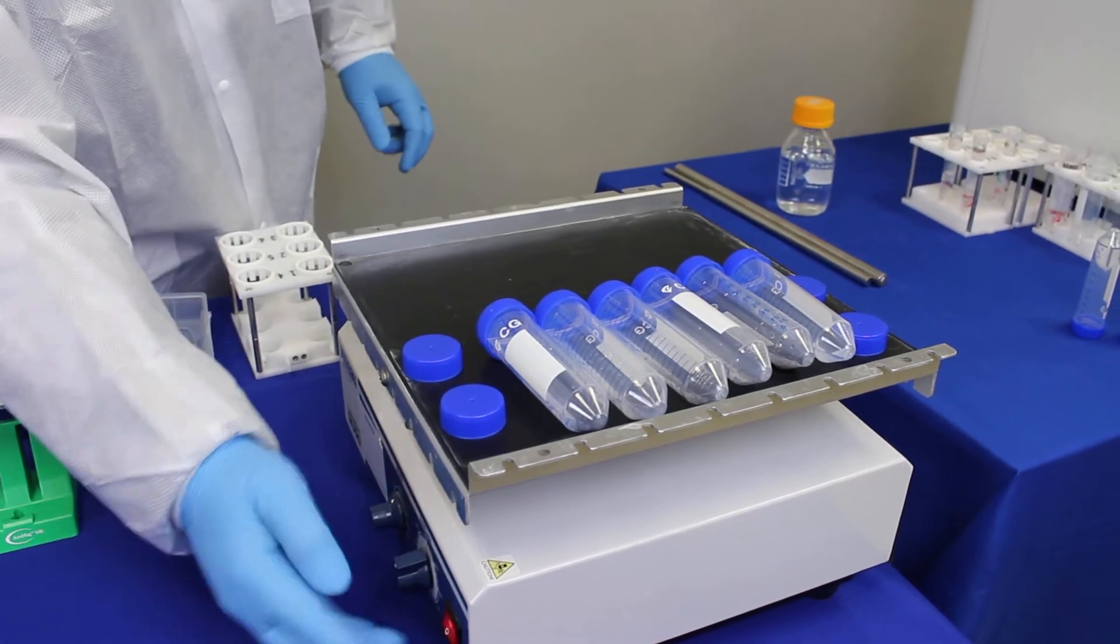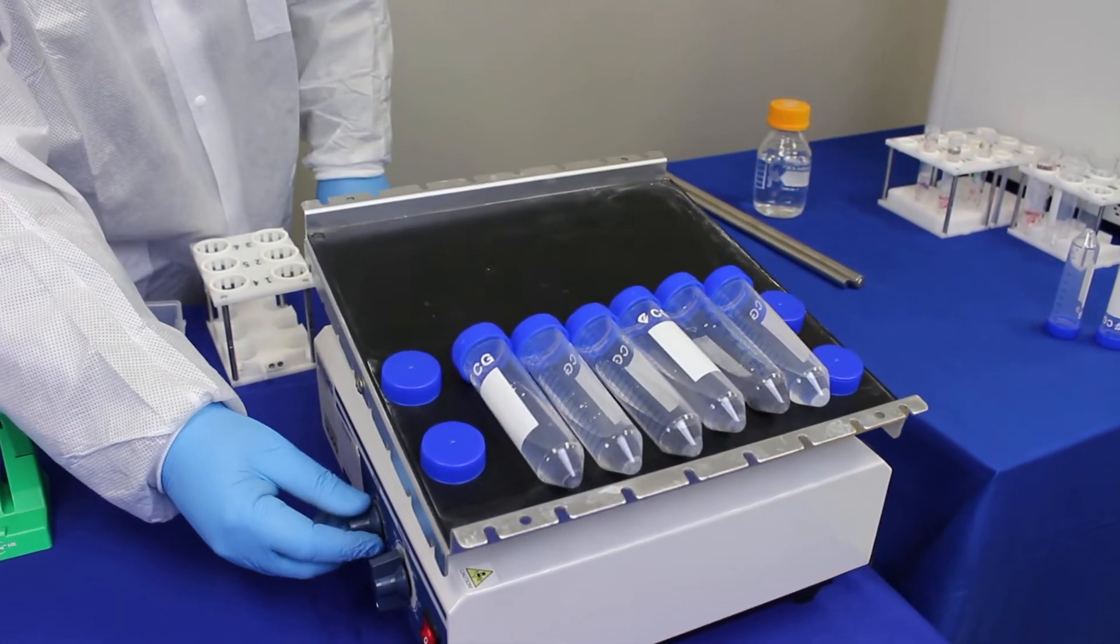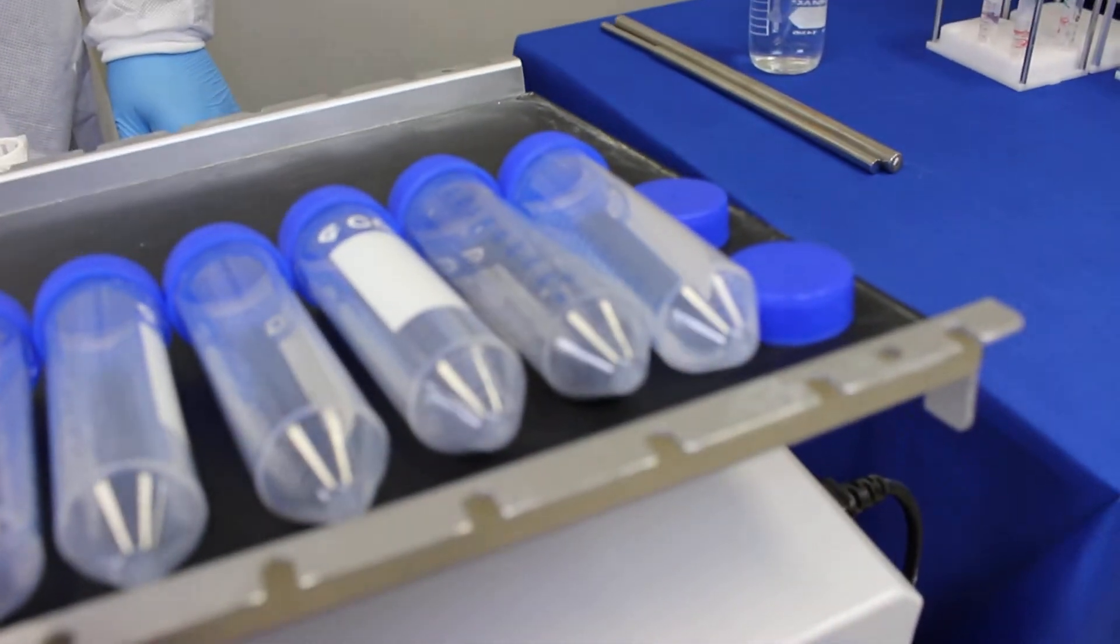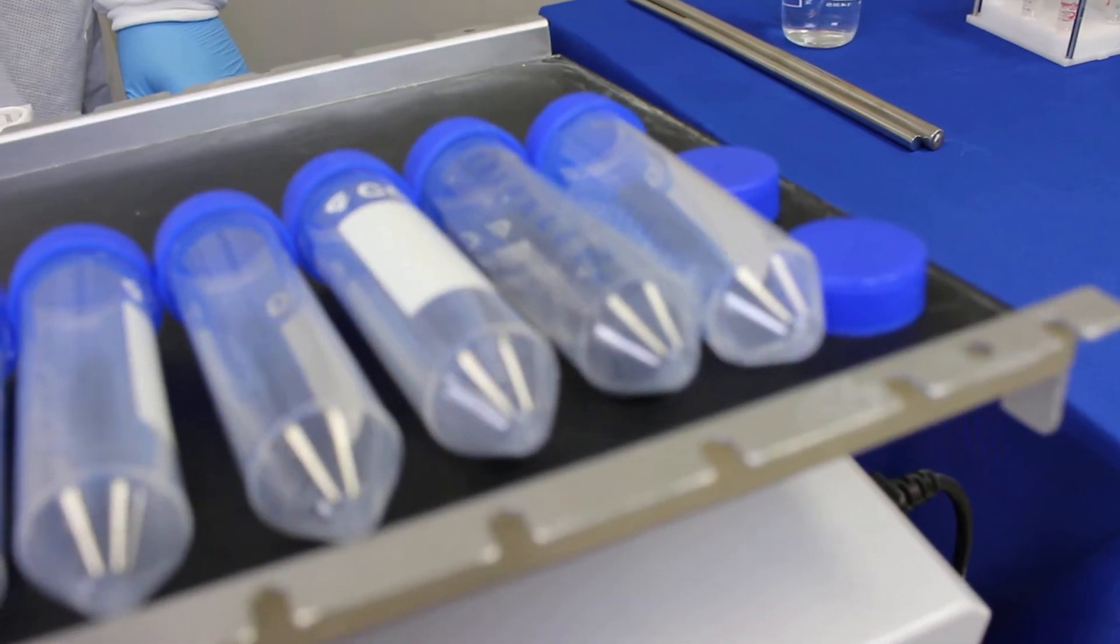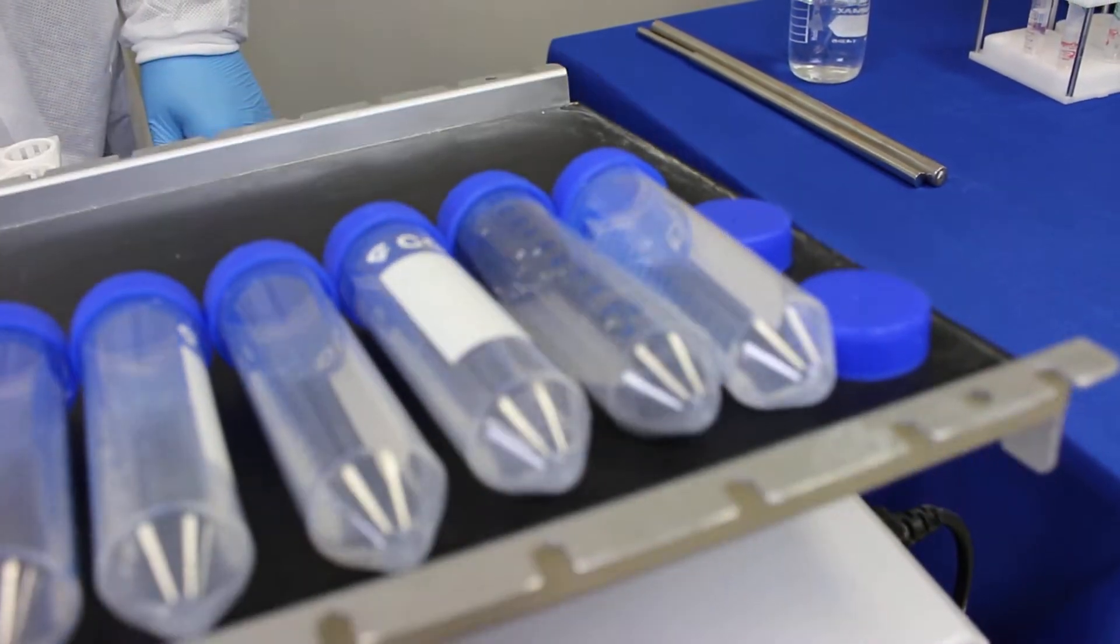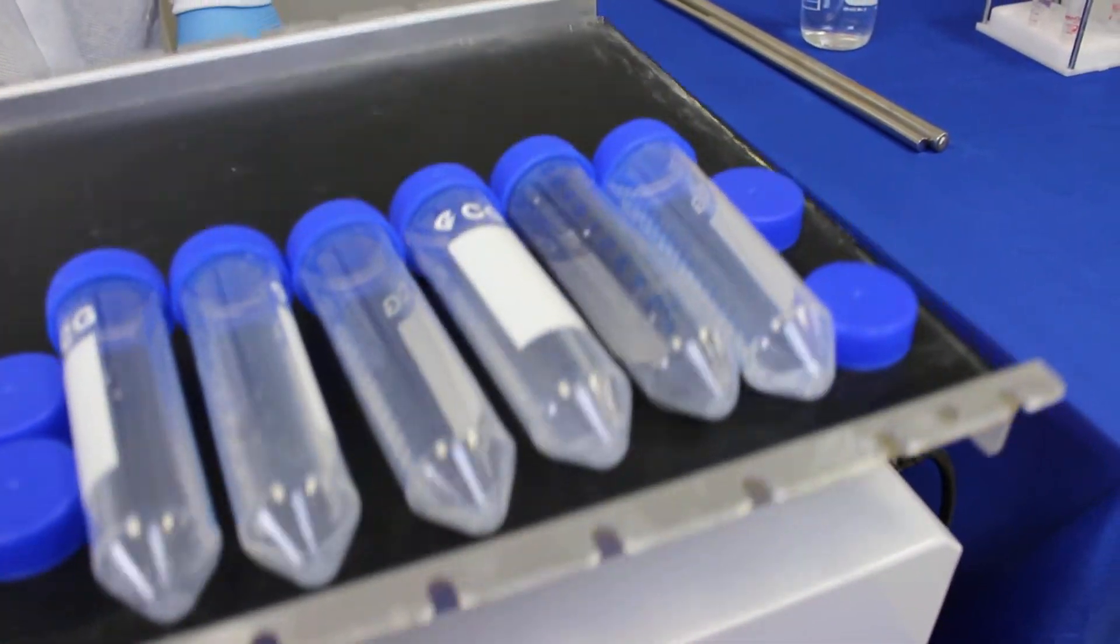Then you switch on the shaker and make sure to adjust the speed so that you see that all the beads are being suspended properly and they are not settled. It's very important so that the entire culture is coming in contact with the magnetic beads.